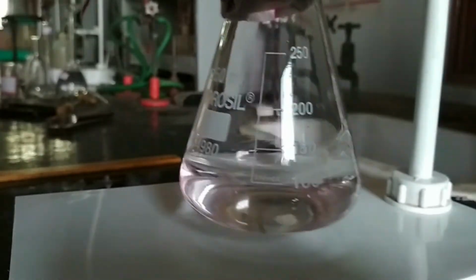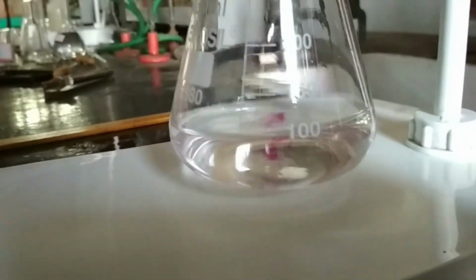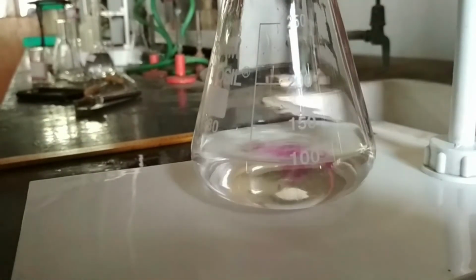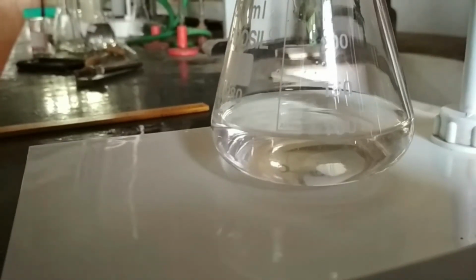So after vigorous shaking, the pink color of the solution disappeared as shown here. And now we observe that addition of a drop of pink KMnO4 to the hot oxalic acid solution at once discharges the color of the solution, and then one can continue the titration till the pink color appears a second time and persists for at least 30 seconds or more. This indicates the endpoint or neutralization point of the titration.